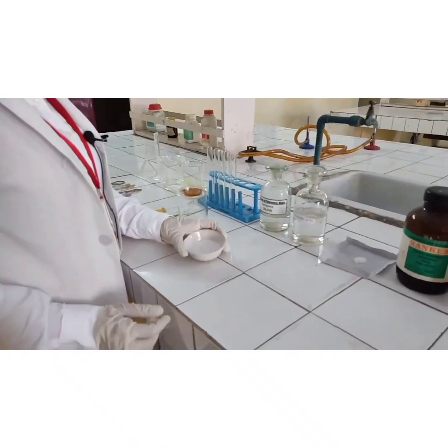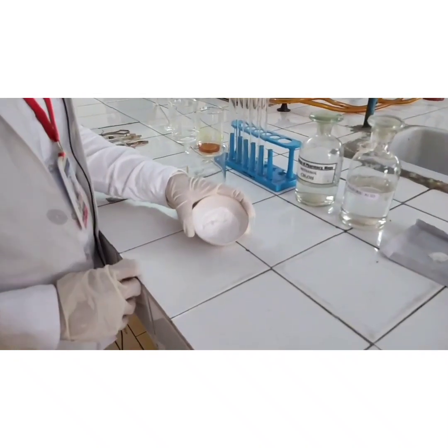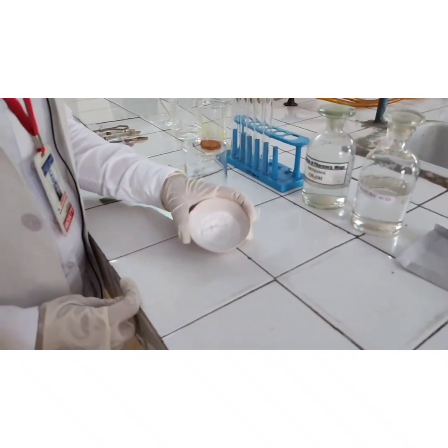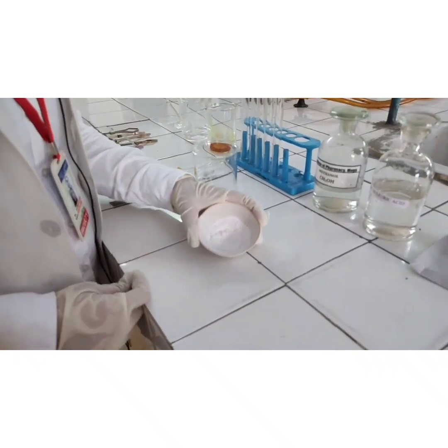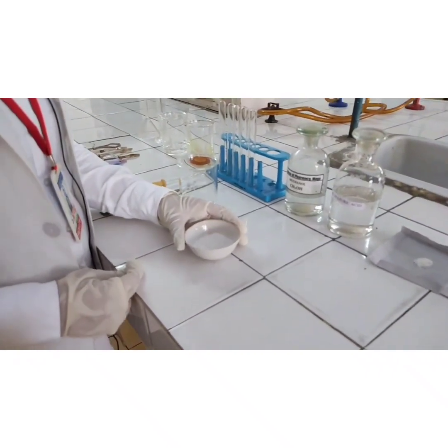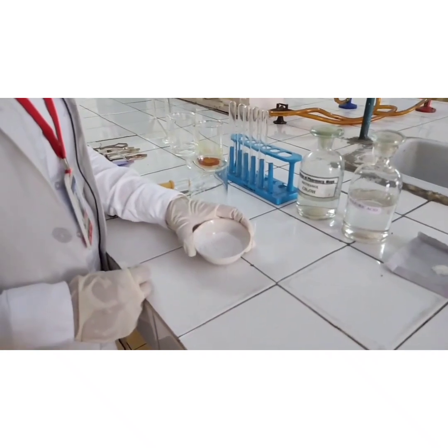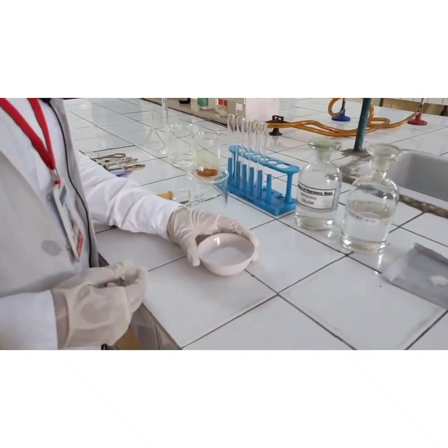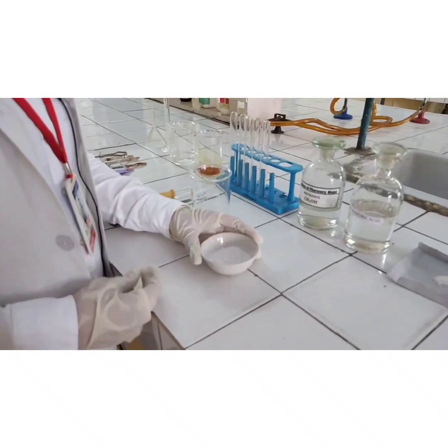As you can see, the color of our organic compound is white, so no information can be drawn from the color. The compound is also odorless, so again no information can be drawn from its odor.